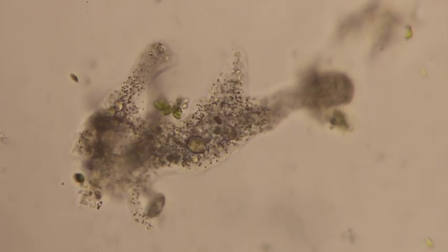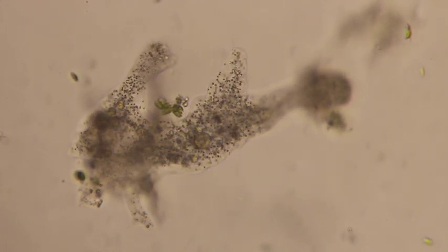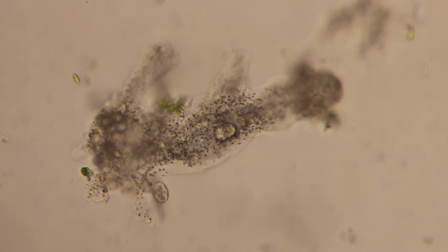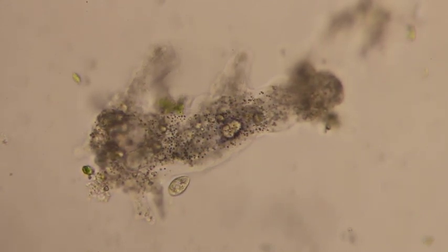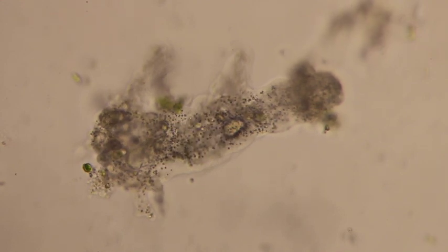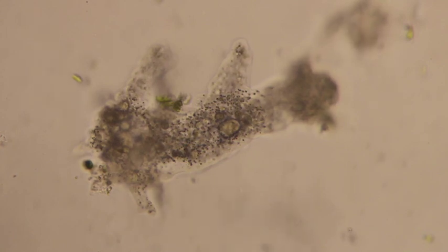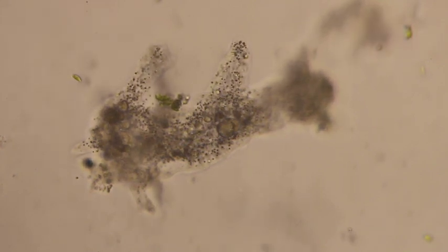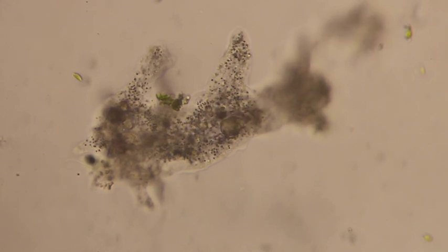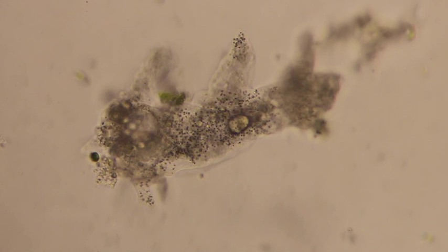You can see right here that the amoeba is engulfing these little green guys. They swim in, the amoeba attracts them, surrounds them with its pseudopodia, and then ends up taking them into the cell. Inside this amoeba cell you can see all kinds of vacuoles where it has organisms that it's captured and is going to eat.